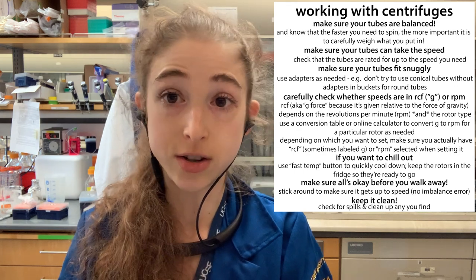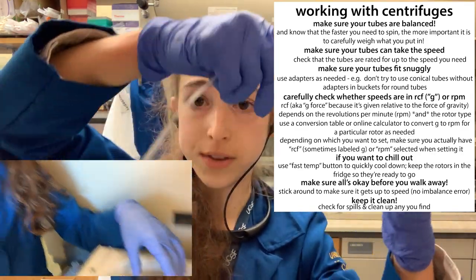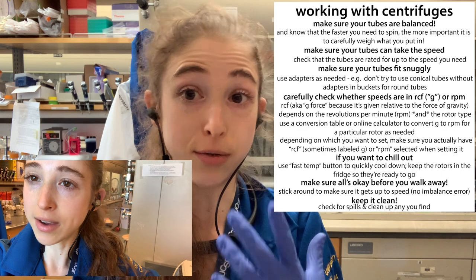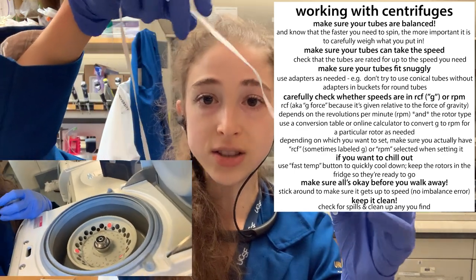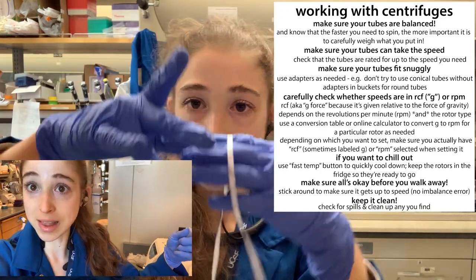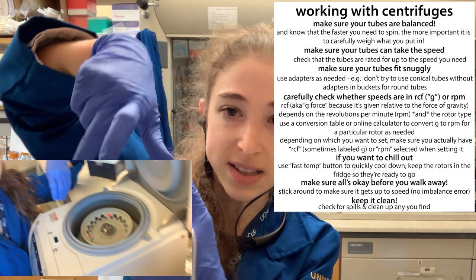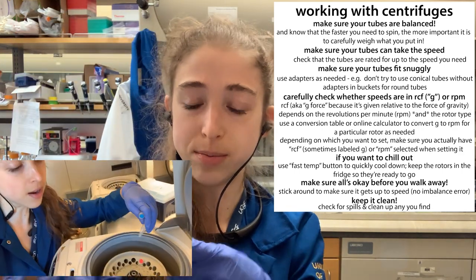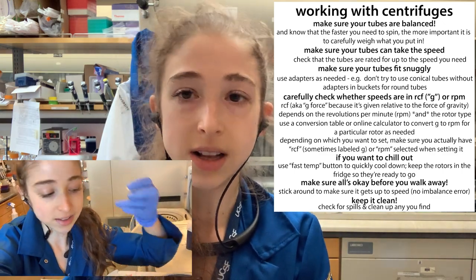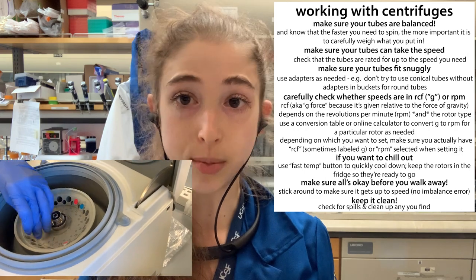When using any of these centrifuges, you need to make sure they're balanced. If one side has force applied with nothing opposite it, the centrifuge will likely detect the imbalance and alert you. To balance, you need an equal weight directly opposite. If you have three tubes, space them out evenly. The faster you go, the more important balance becomes — especially with ultracentrifuges, you need to be very careful about this.